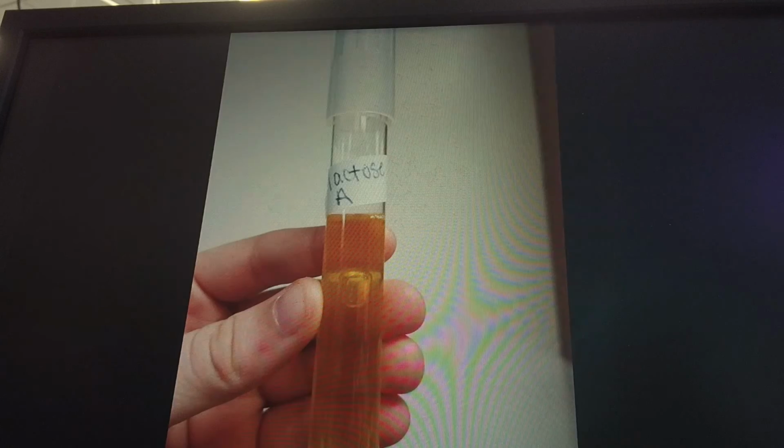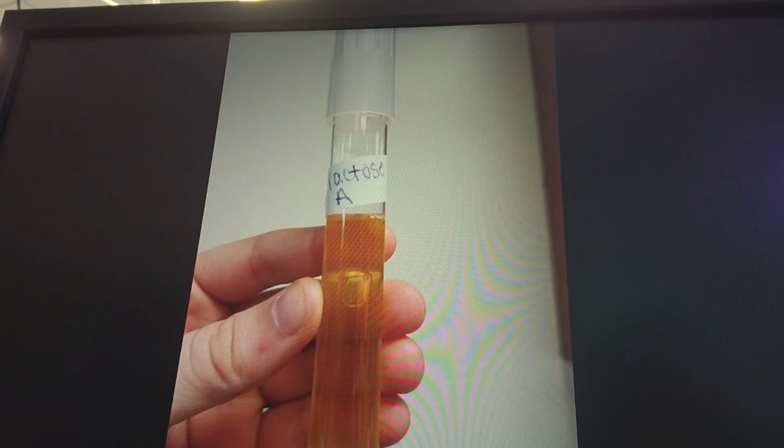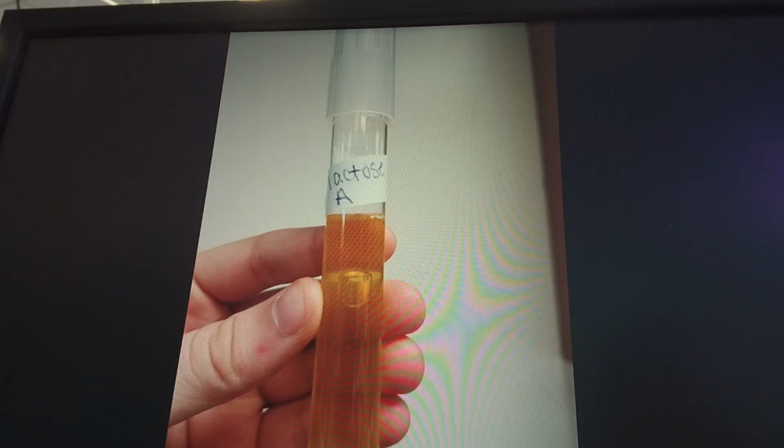This narrowed our search from 26 down to 13. The next test we performed was a lactose phenol red test. This tests for fermentation of lactose. This also tests whether or not a gas was produced. The test is differential for oxidation or fermentation. If lactose is fermented, the liquid will turn from red to yellow, and if a gas was produced, you will see a bubble within the tube. We found that our unknown did ferment lactose and also produced a gas.